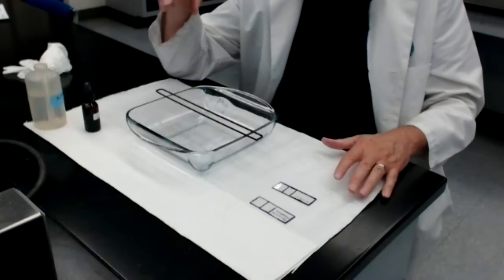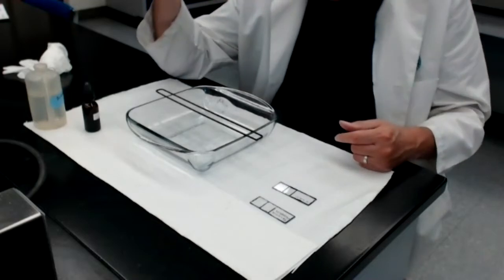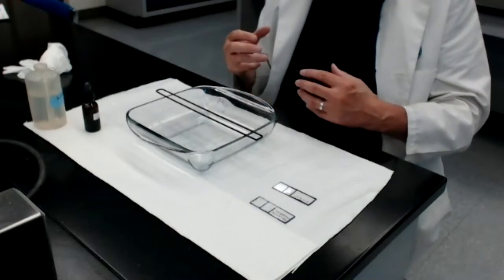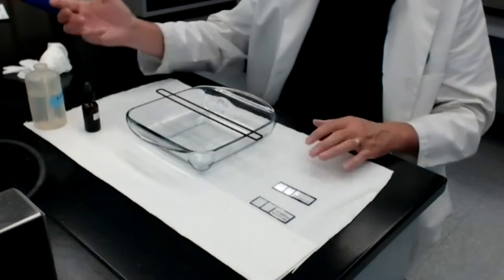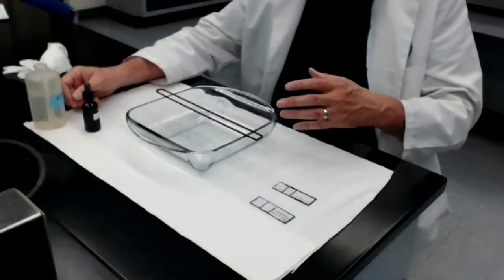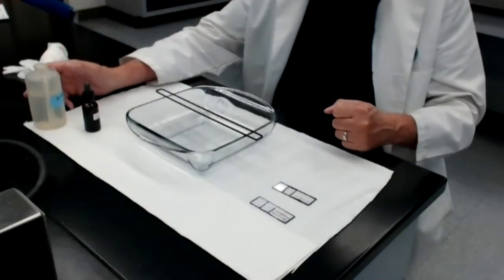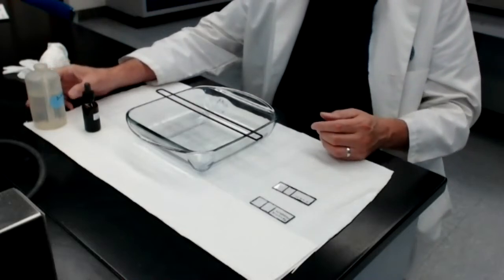Bacteria that can store excess lipids and fats inside of themselves to be used at a later date, those fats and lipids that are being stored inside the bacterial cell are a type of reserve material. The materials are being reserved for use at a later date. Now, there are a number of stains that have been designed to stain reserve materials, to stain phosphate, to stain lipids and fats. I'm not going to say more about those stains because we aren't going to do any of those stains in this class.